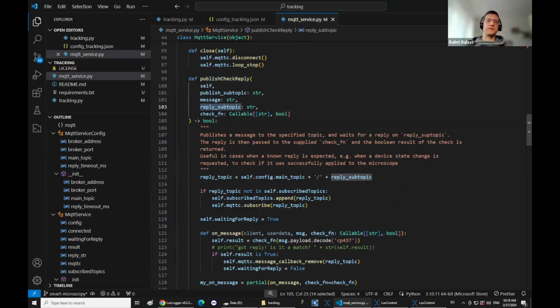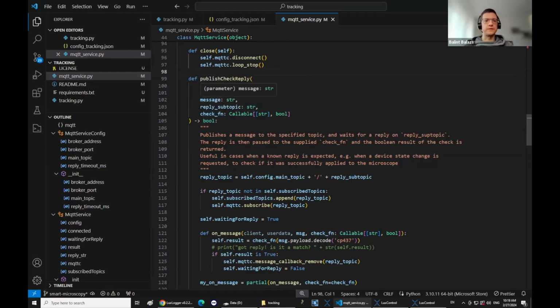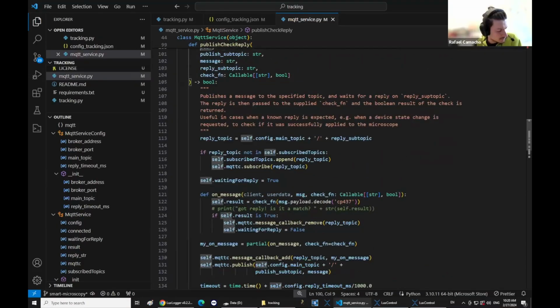And then depending on the function, you will get true or false. For example, if you want to set the laser and you expect the reply to have the same laser settings that you configured, then in this check function you can do some parsing to make sure that the laser is what you expect. All right, so it's not only taking care of the messaging, it's taking care of checking for the replies and therefore the synchronization.